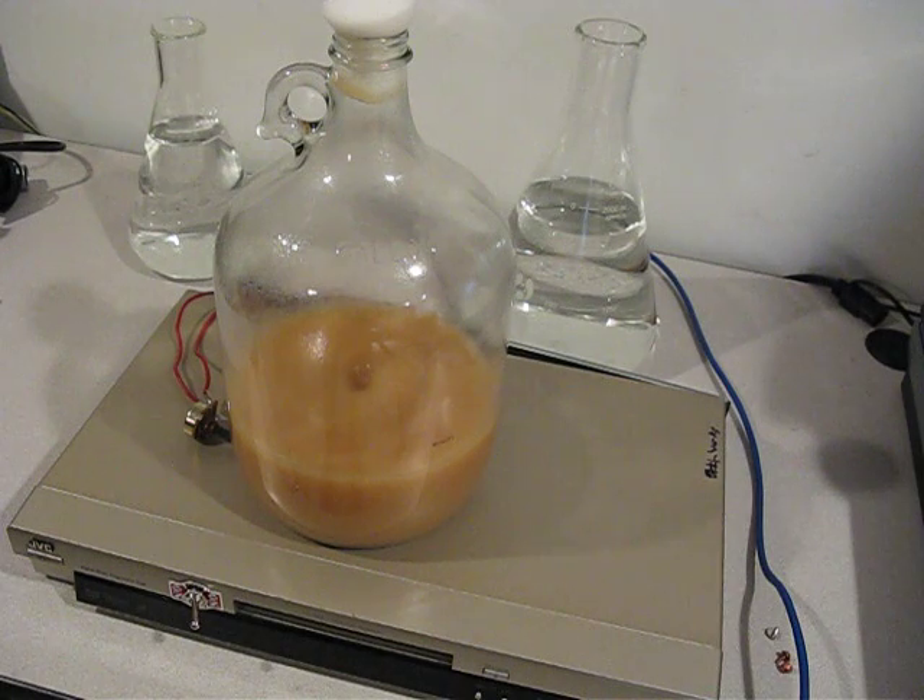I went out and got a bigger magnet to put inside the flask — a two-inch long magnet for this one-gallon jug. That may or may not have been necessary, but I wanted it because I want to try using this on a carboy. I think the steel casing, once I have all the screws in, will hold up the carboy. If not, I'll put a block of wood inside to support it further, but I'll try it without first.